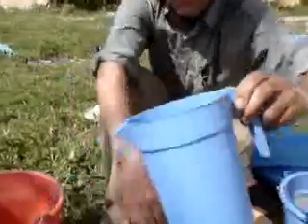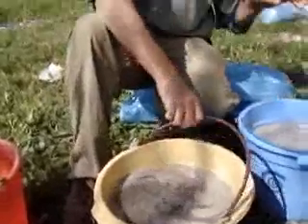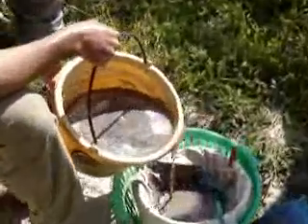Once it's well stirred, you want to pour it into your sieve. The trick is you want to pour the charcoal that's floating but keep the sand that isn't floating, which means you have to pour gently. Not too slow or you won't get anything, but not too fast or you'll end up with sand clogging your sieve. I rock it gently to try to draw the charcoal out, bring it forward, and just pour off the top layer of the water. You can see how the charcoal works its way over the edge and gets caught in the sieve.